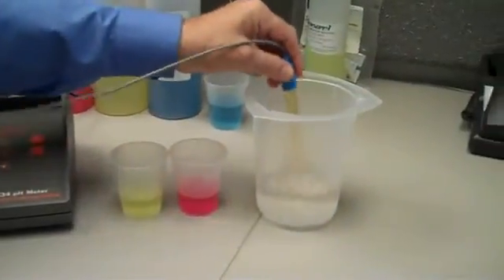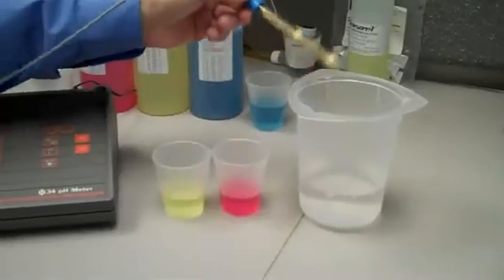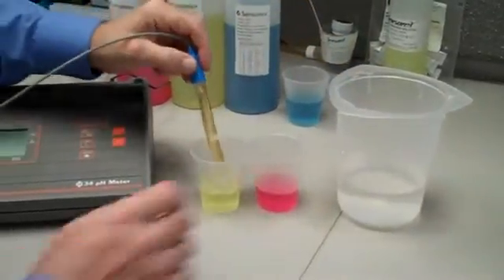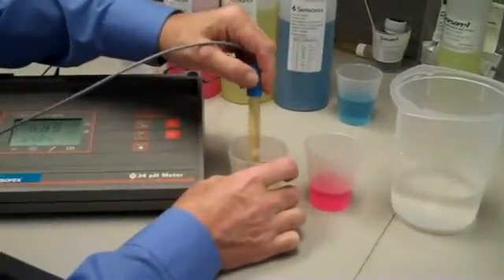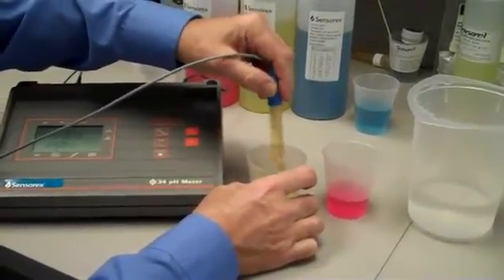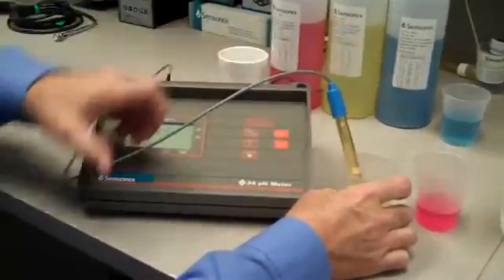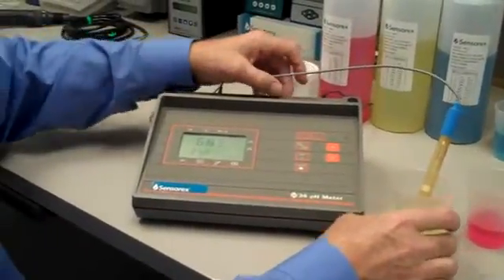I want to take the electrode, swish it around in some rinse water, tap it on the edge of the beaker to remove residual liquid, and then place the electrode into pH 7 buffer. Stirring vigorously for a few seconds will remove any entrained air, and also make sure that you're mixing the sensing tip nicely with the pH buffer.